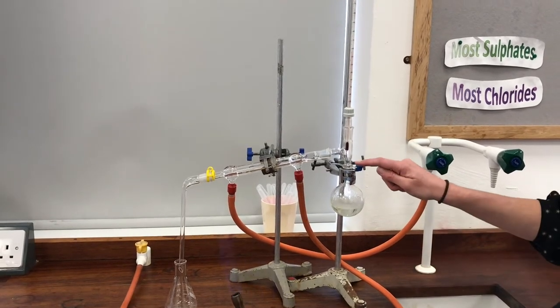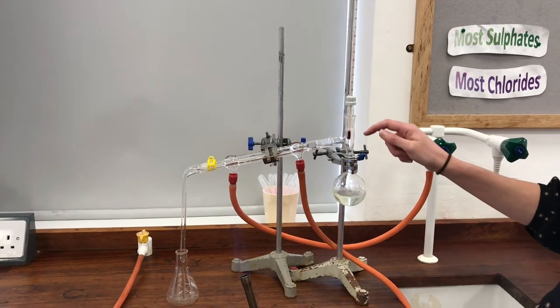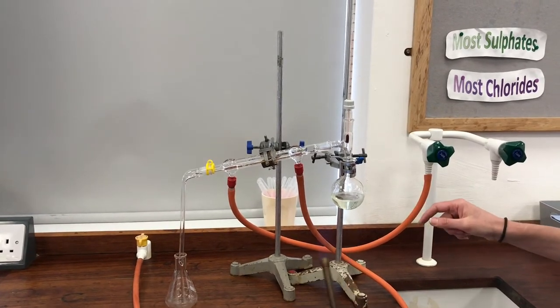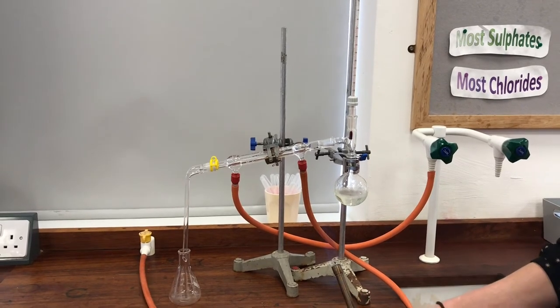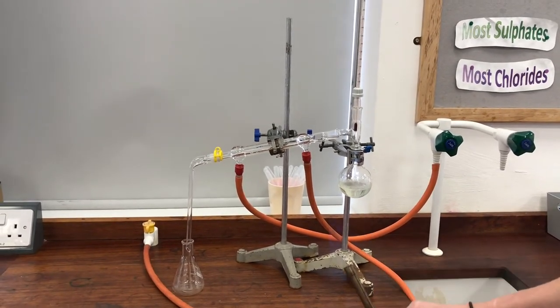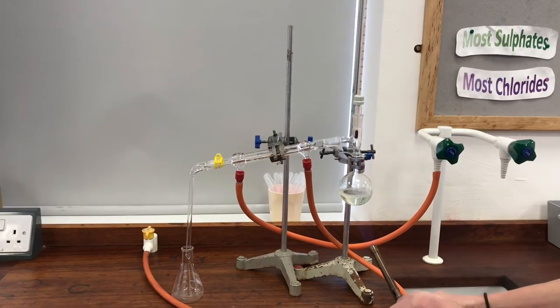You may also be able to see there's a lot of liquid now formed up in here from the vapor and it's starting to drip off the bottom of the thermometer. So I want to carry on heating this in a really nice controlled way so it doesn't get too hot, and you can see that my temperature on my thermometer is going up now. It's on 75 I think.